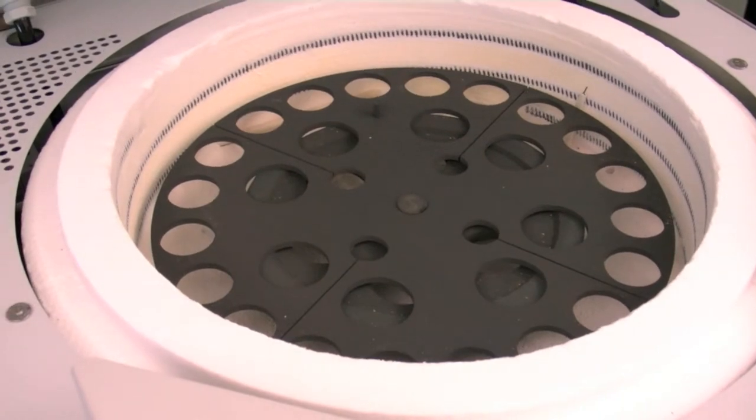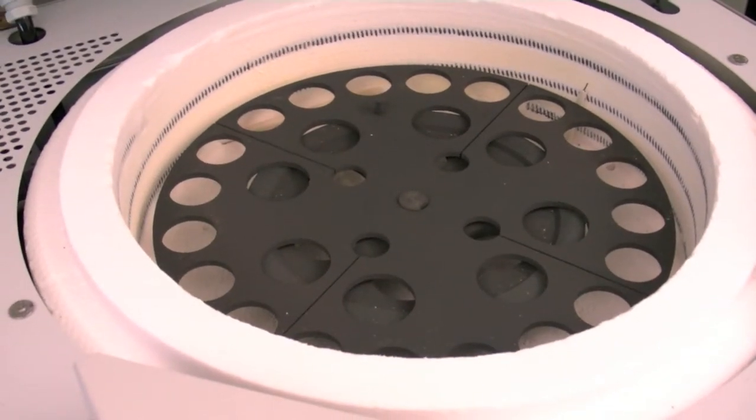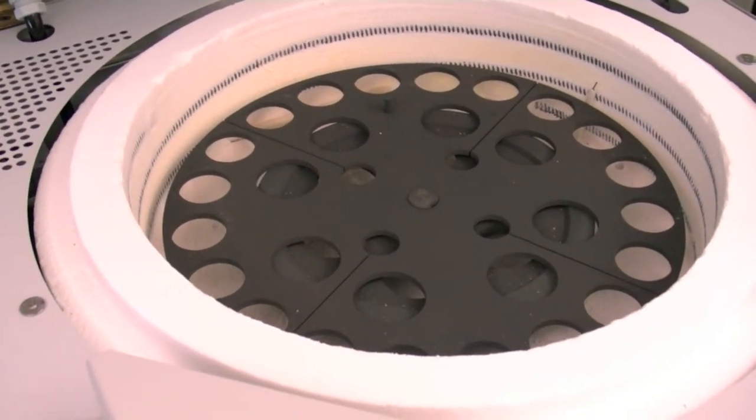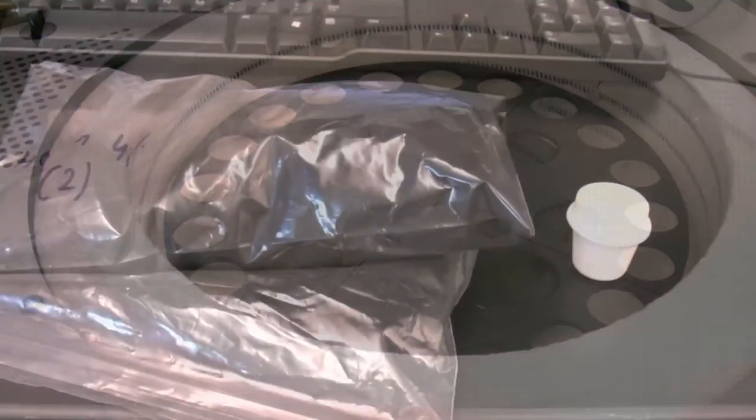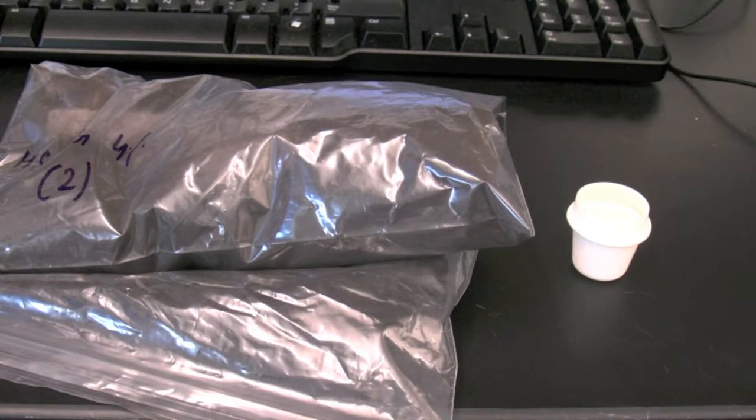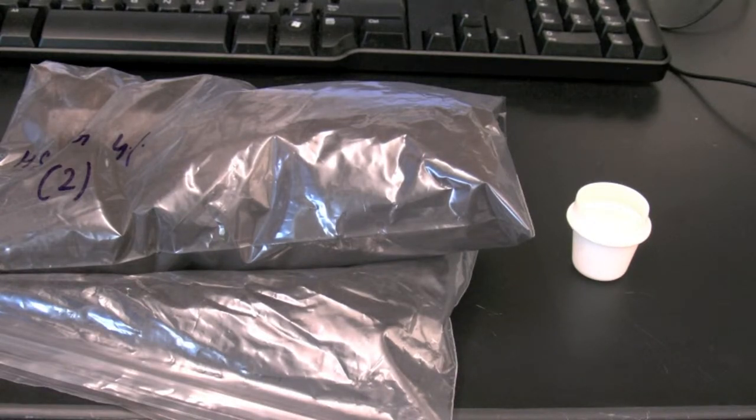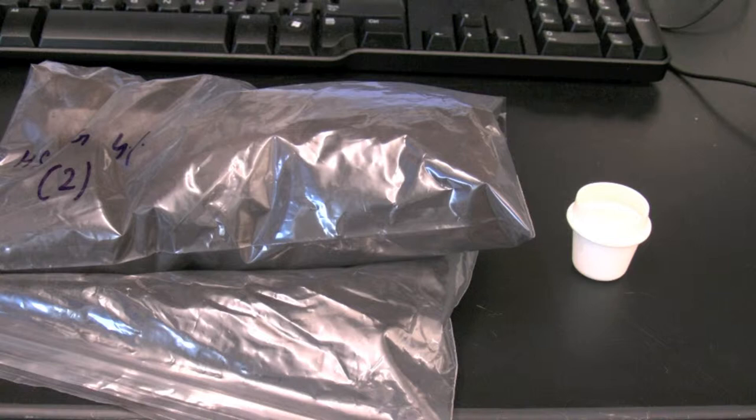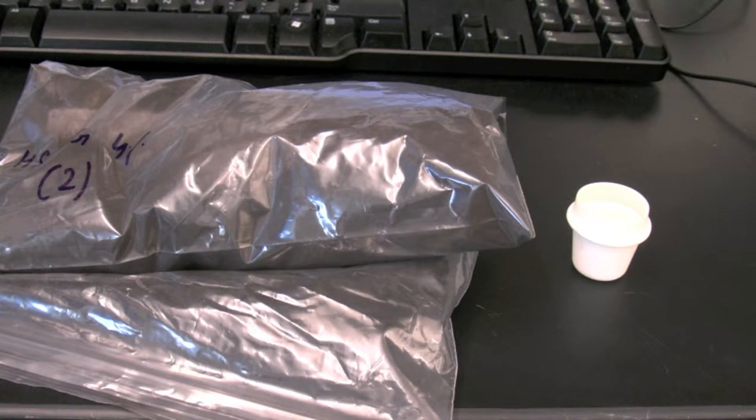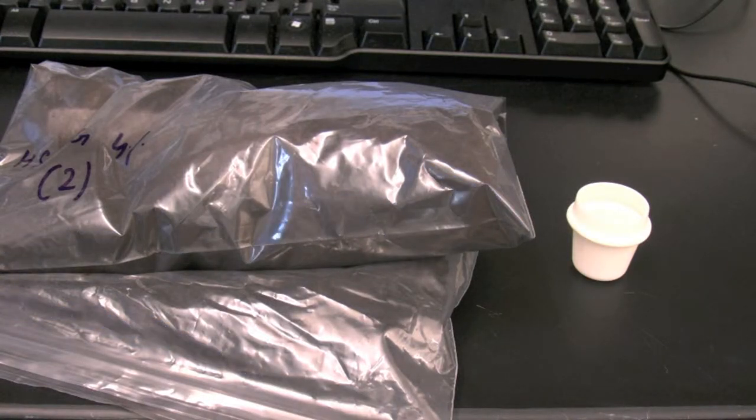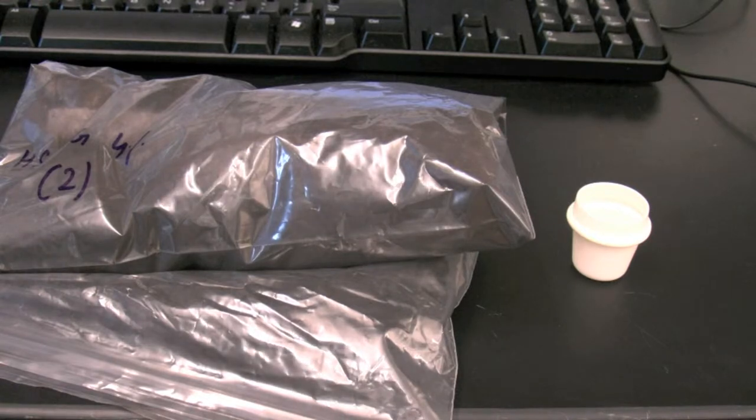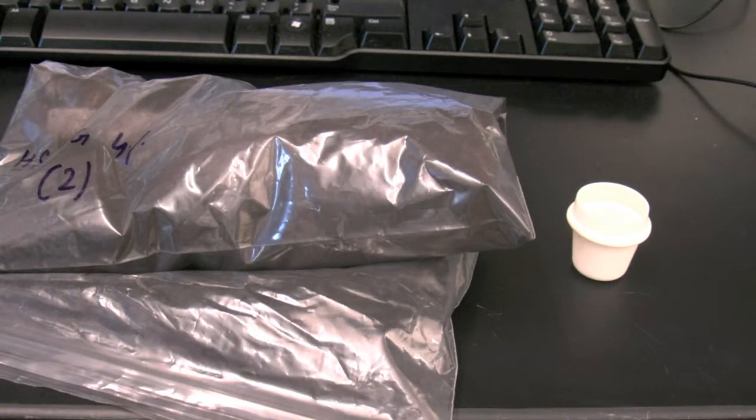Make sure all crucibles have been removed from the carousel and cleaned. Your material choice should be in small enough particle sizes to fit completely inside provided crucibles. The scale can read up to four decimal places and the heaviest sample size allowed is 10 grams.